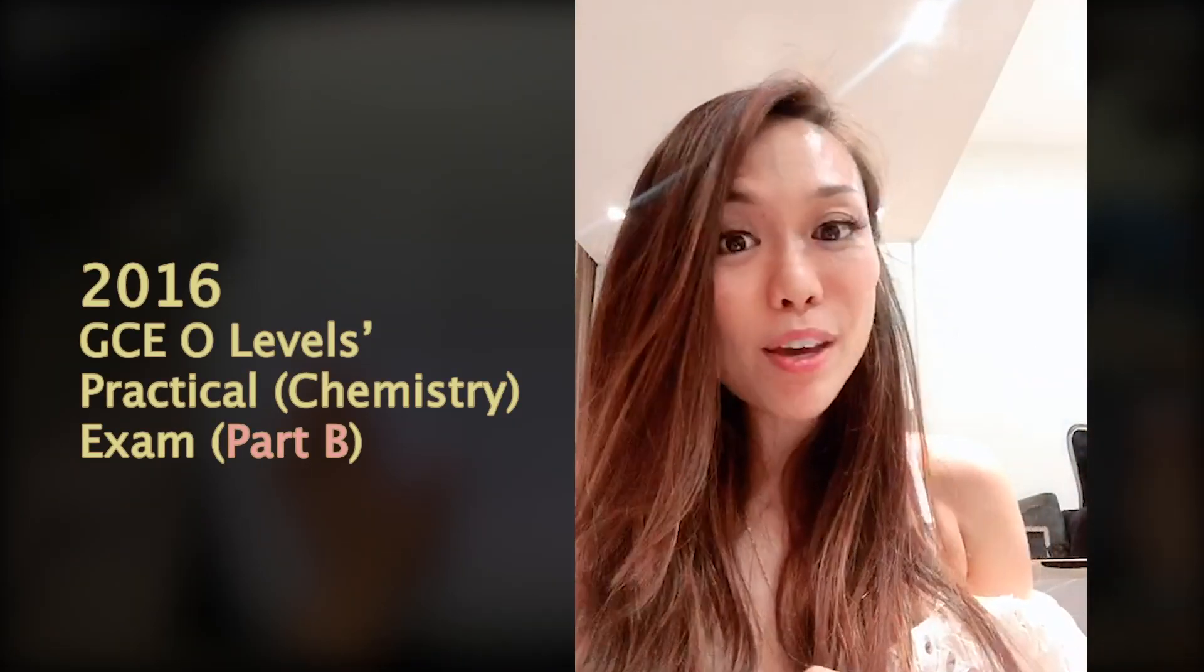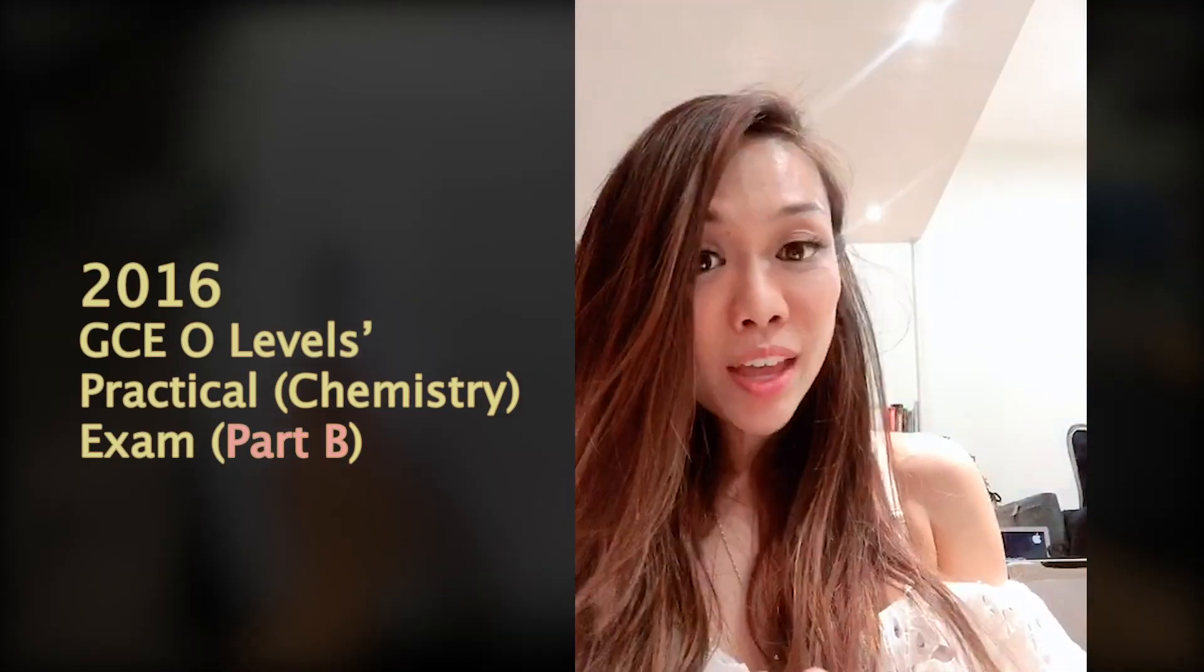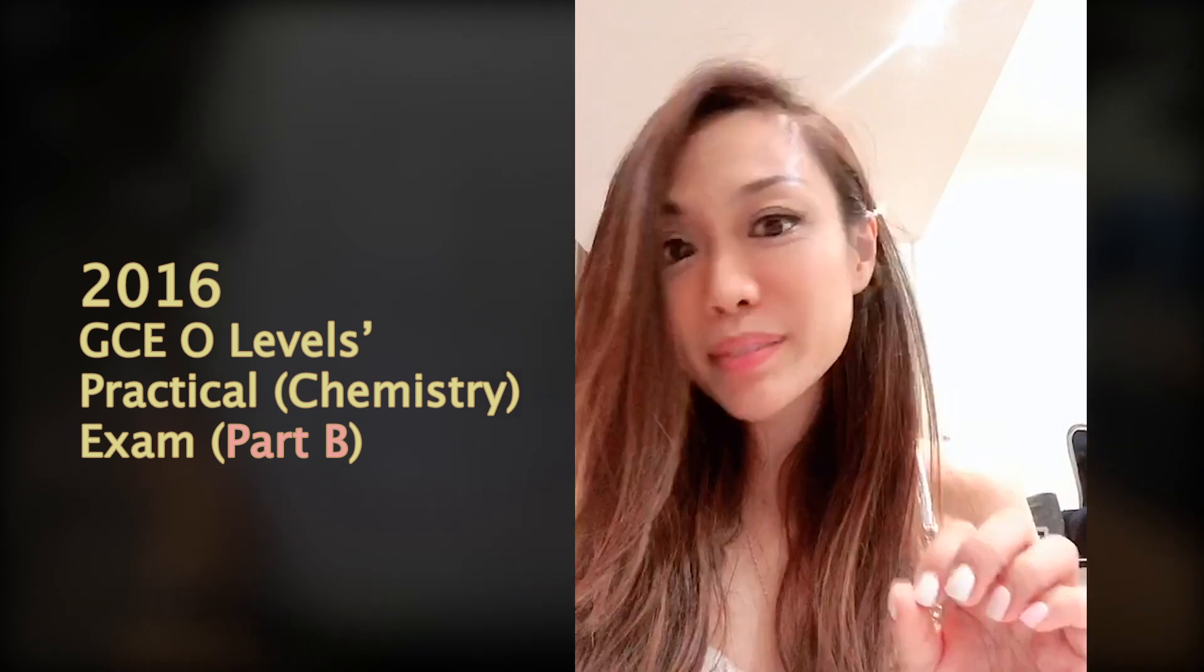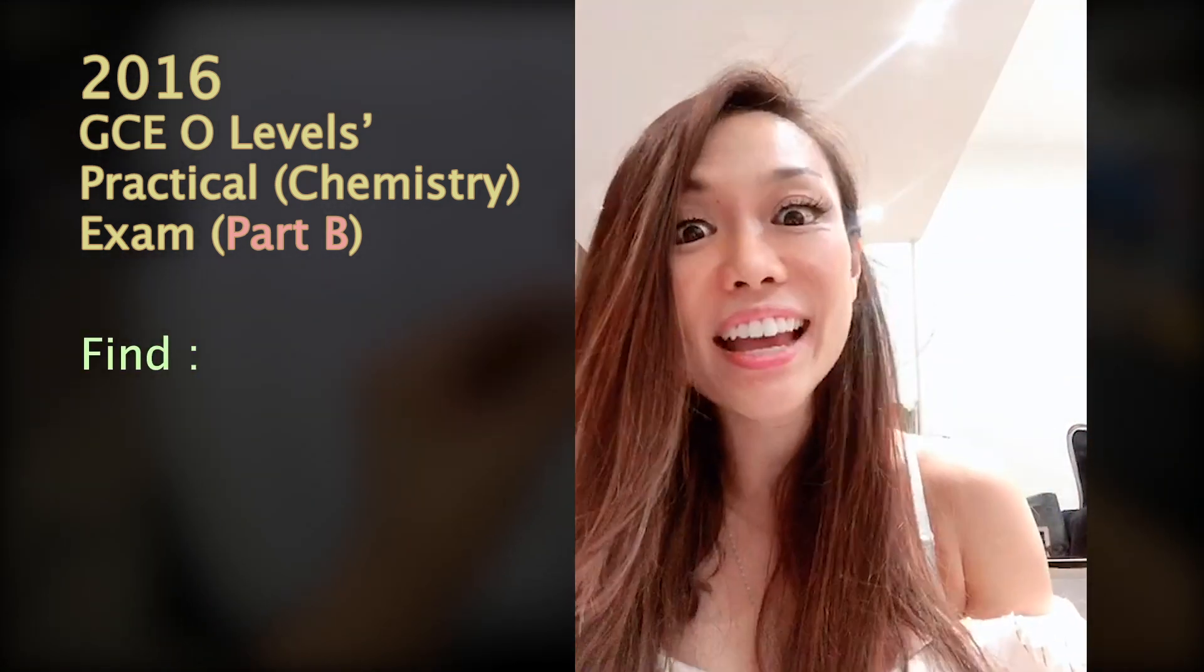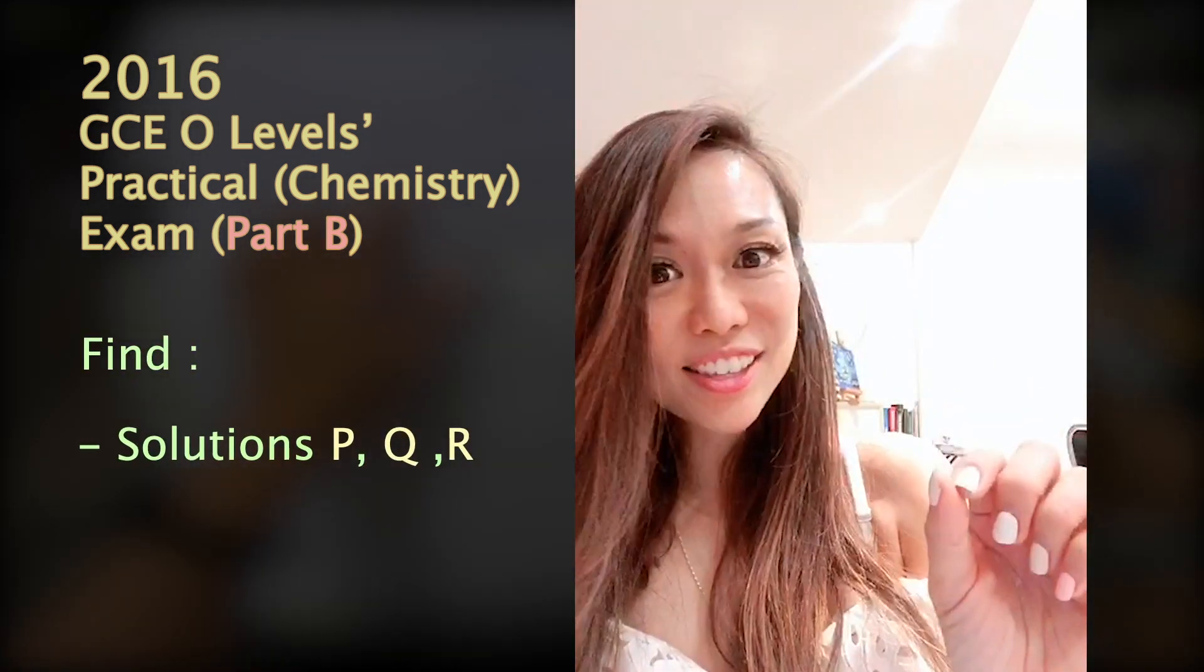Hi, we're going to go through part B of 2016. Are you ready? Now, this portion you're going to see something very interesting because they're going to introduce a solution and with that, they are going to help you find out who exactly is PQR. So get ready for some fun experiment.